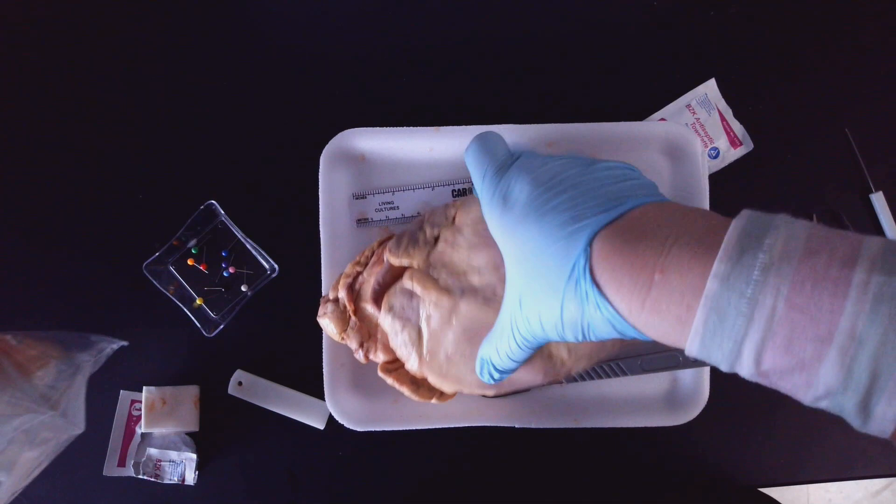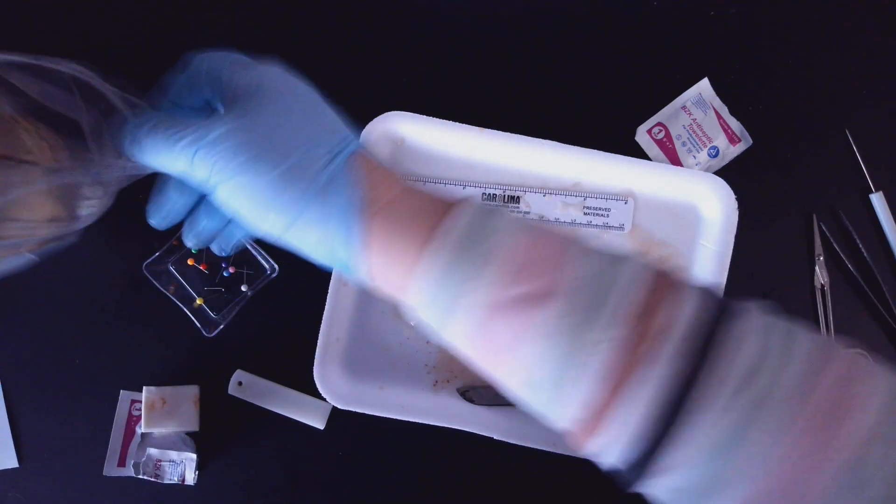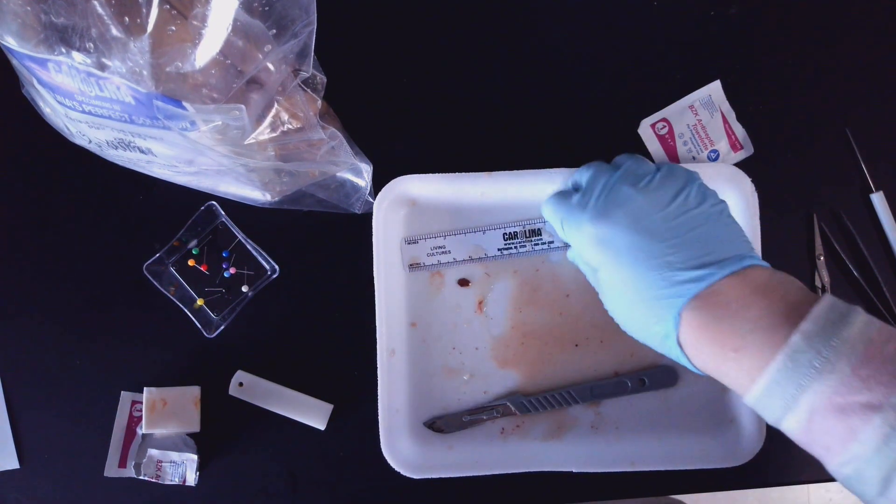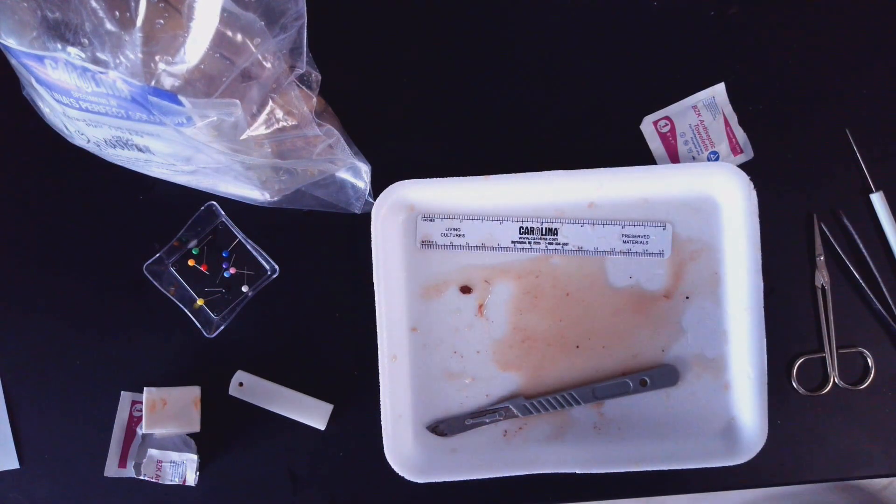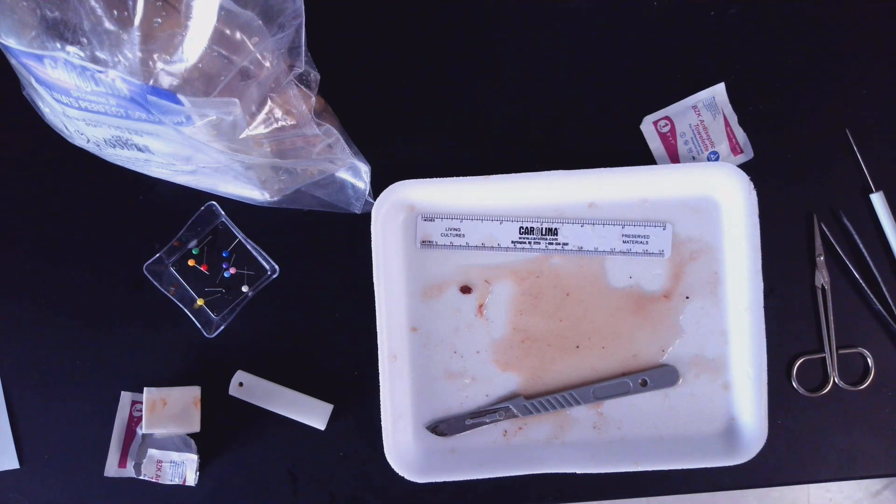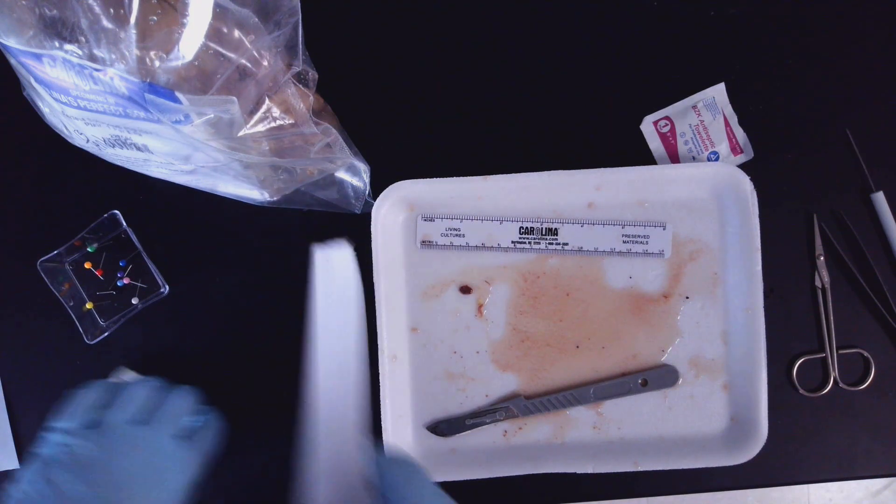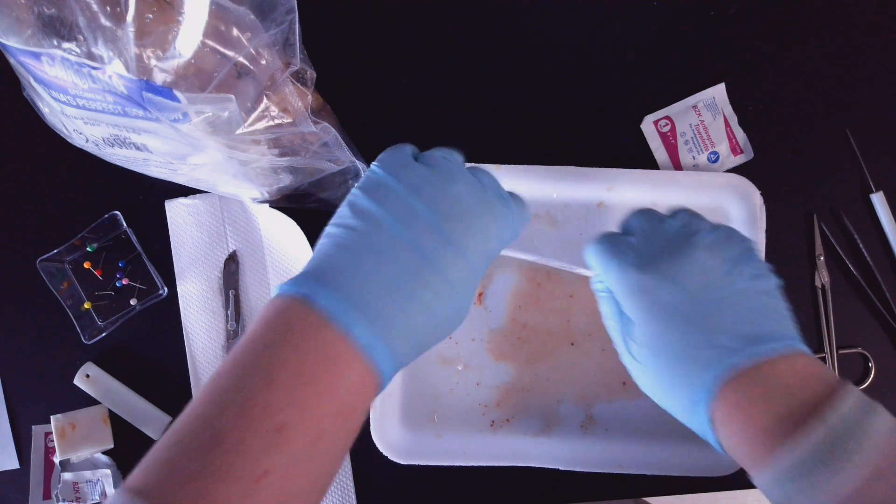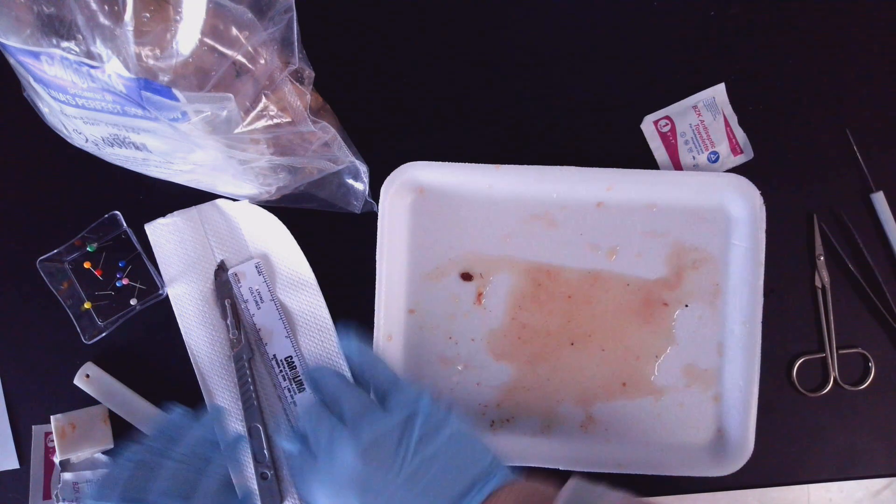Put this heart inside like that. You're going to get a paper towel - not using the tissues at your desk, tissues are for noses. I'm going to set both the scalpel and the ruler, and if I had any other tools on the tray, I'm going to set them on this paper towel.